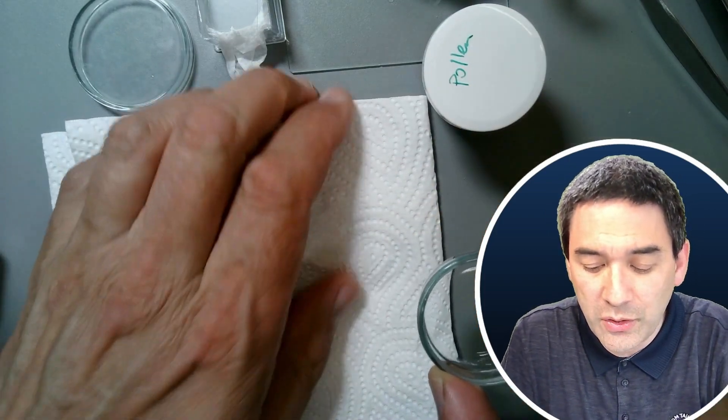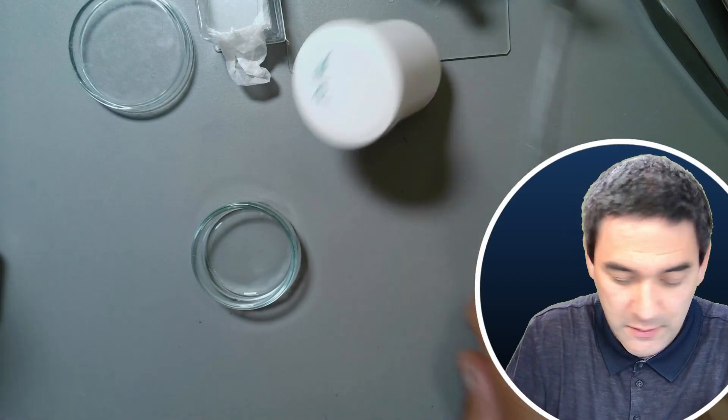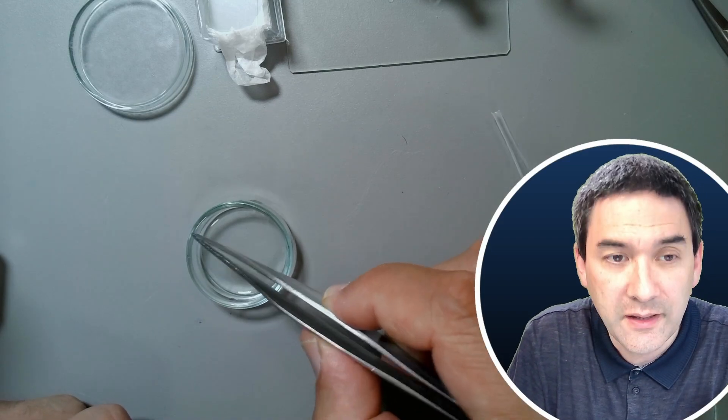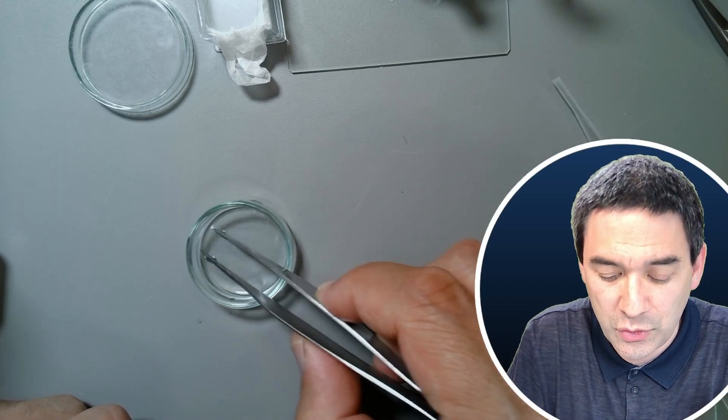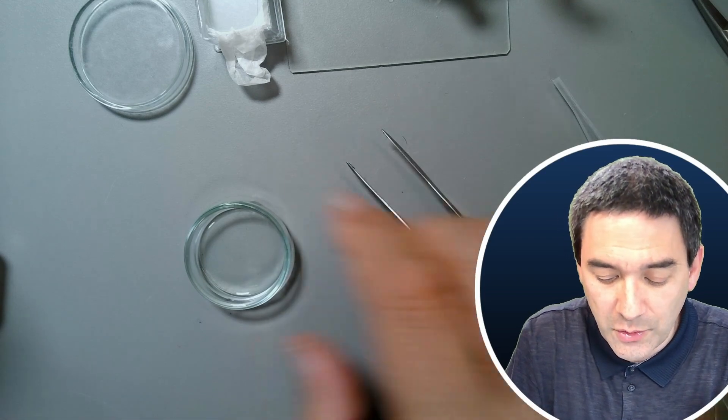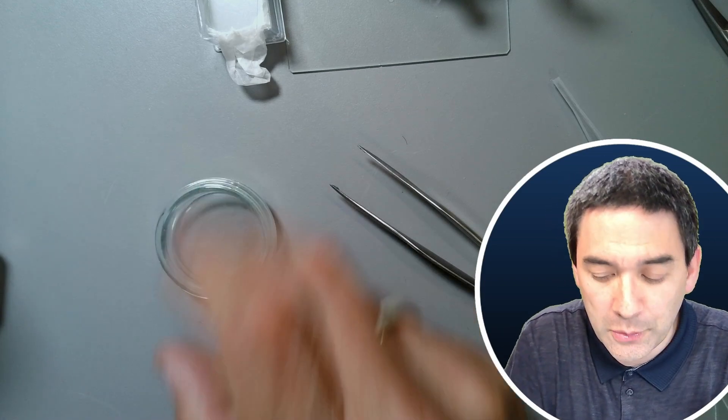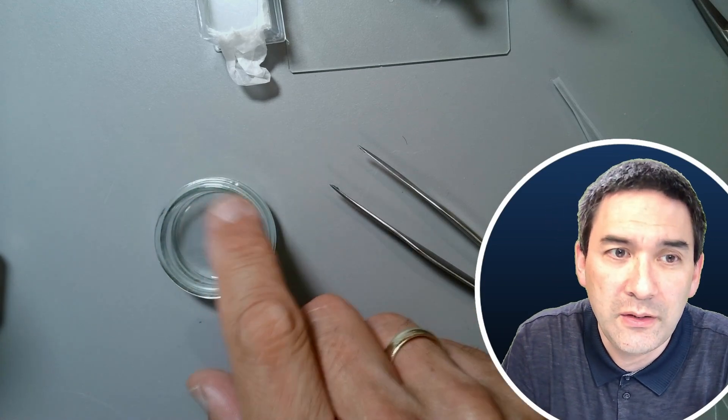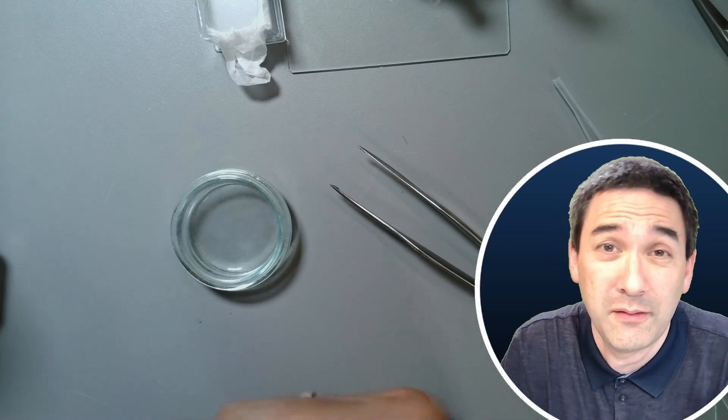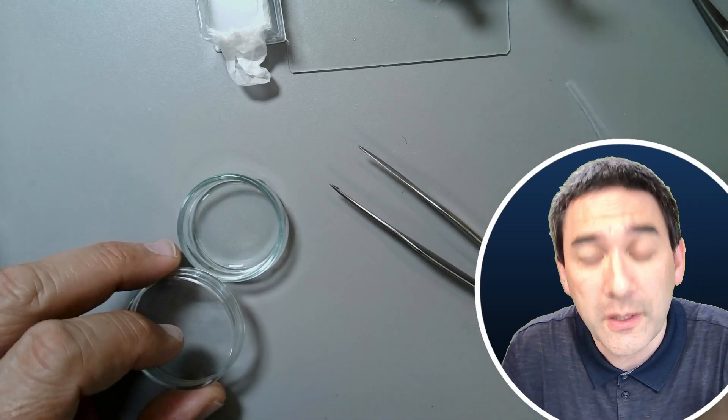Then I'm able to use this water to make microscope slides. As I mentioned before, I can also use the tweezer itself to transfer small amounts of water. This is quite useful. You can prevent evaporation by putting on the lid, or sometimes I put some specimens or water samples into those small petri dishes, and then I just pick them up from here and make my microscope slides.